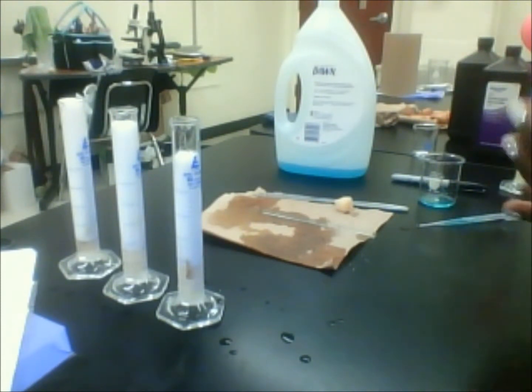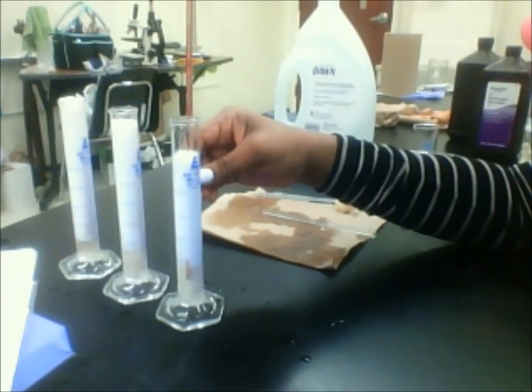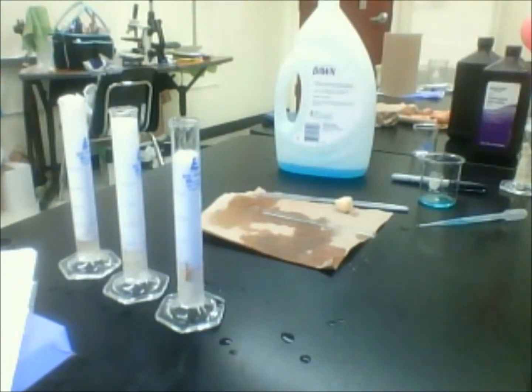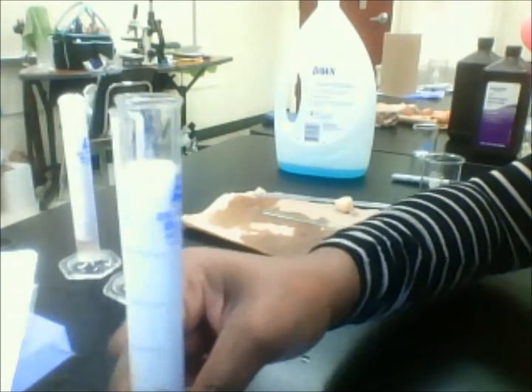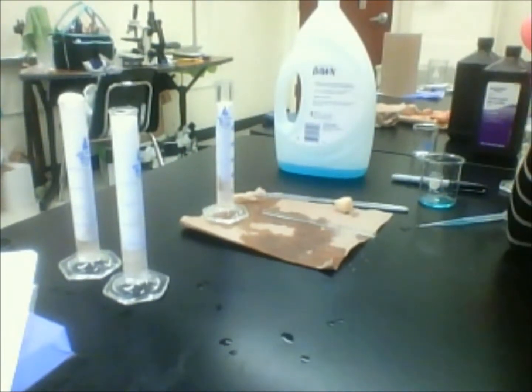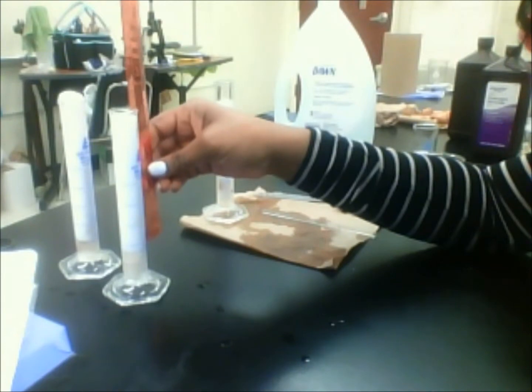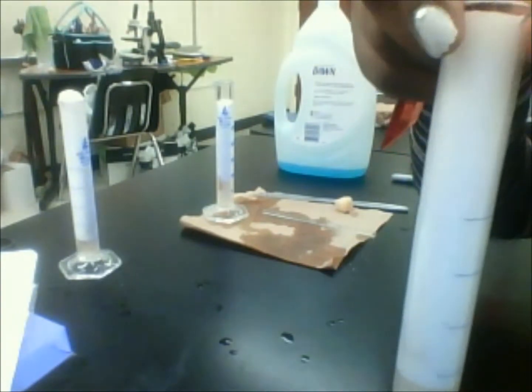So I'm going to measure the height in centimeters, starting from the bottom of the bubbles to the top. And this one is about 9.4 centimeters for that first one that we cut in half. Okay, and just so you can see it, this is what that produced. Alright, the one we cut in quarters is up next. I have about 3 seconds. Alright, so the one in quarters is measuring about 12 centimeters. And this is what this one looks like.